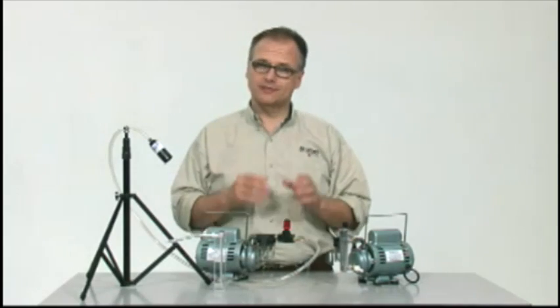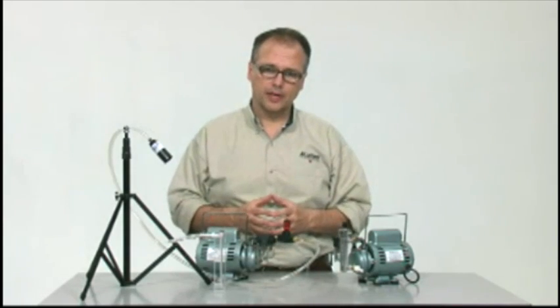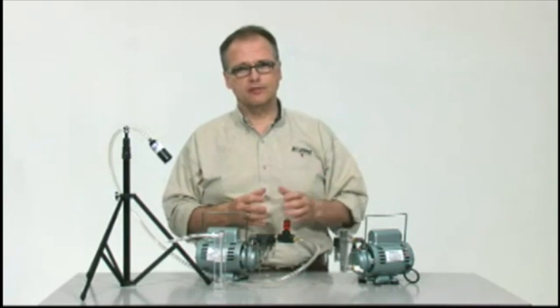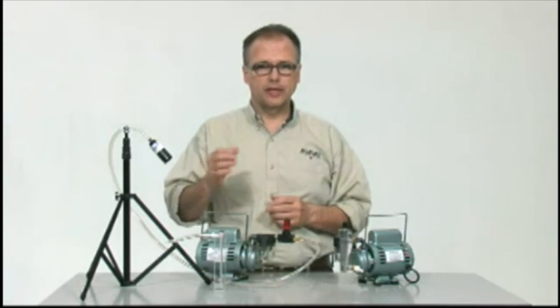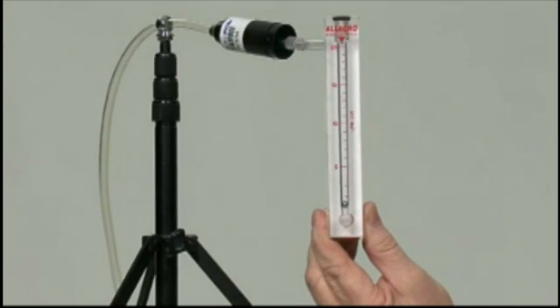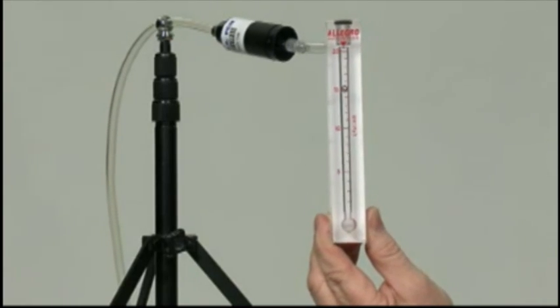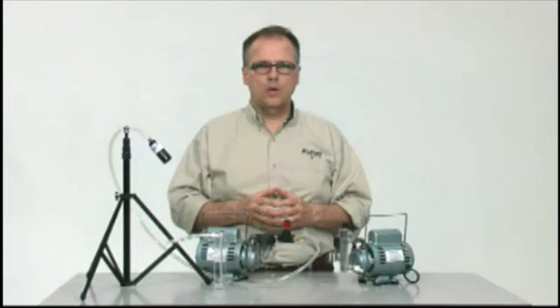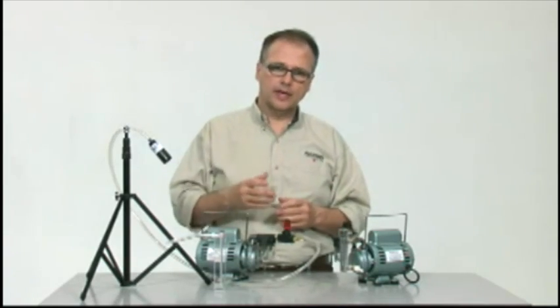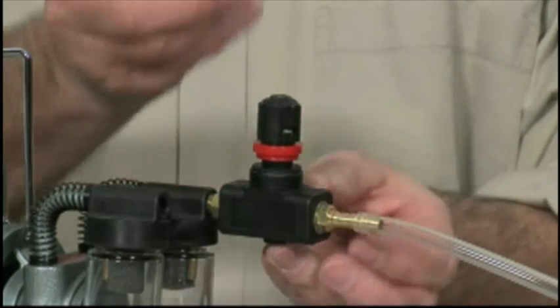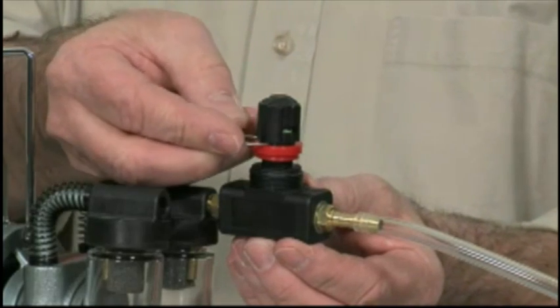Before collecting any samples, it is very important to set the proper flow rate. Some of our pumps have built-in flow meters or an Allegro flow meter can be used. Once the flow meter is attached, turn the pump on and adjust the regulator, making sure the flow meter reads between 10 and 15 liters per minute. Once the flow has been set, Allegro pumps have a locking ring on the regulator to make sure that your airflow doesn't change and your samples stay accurate.